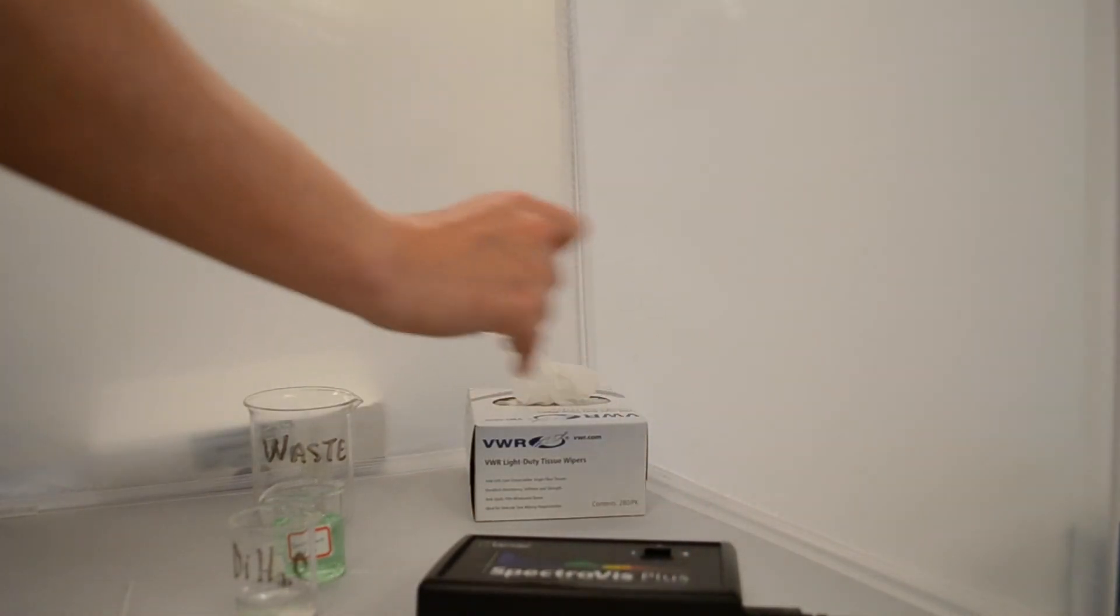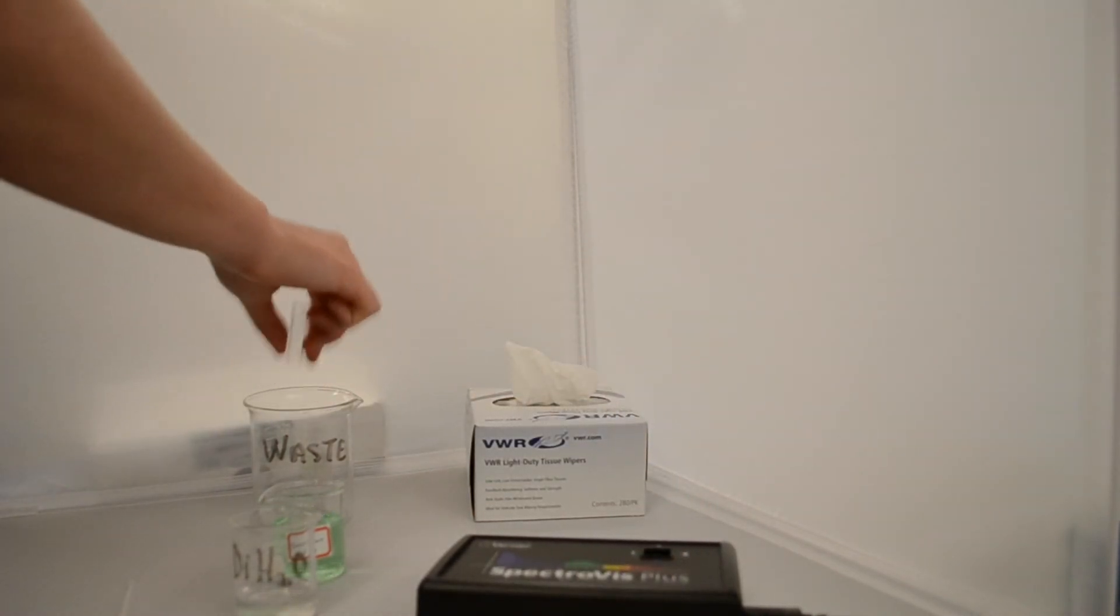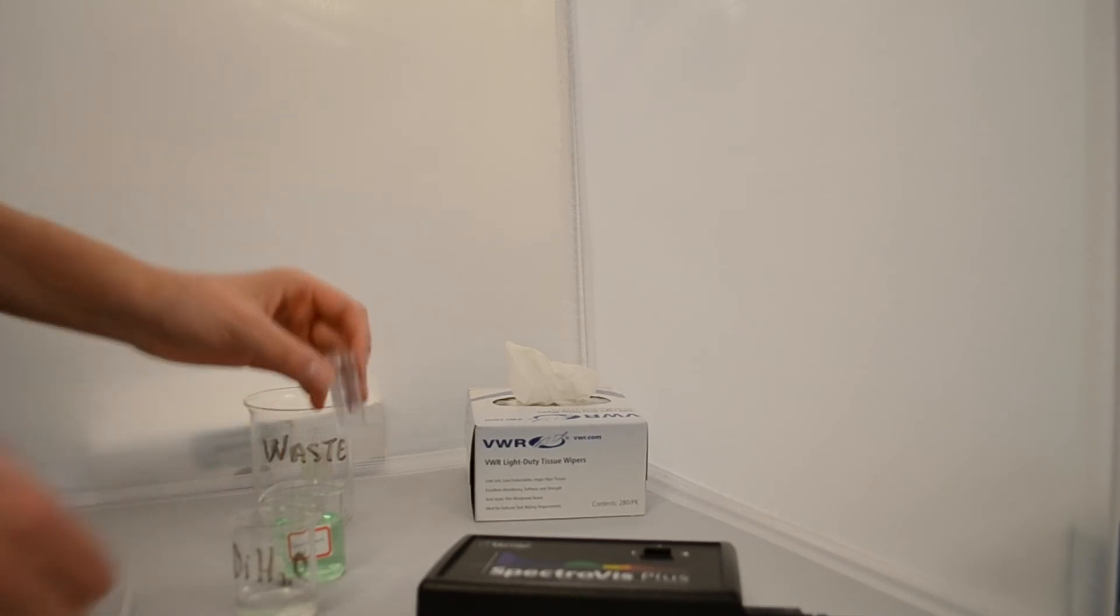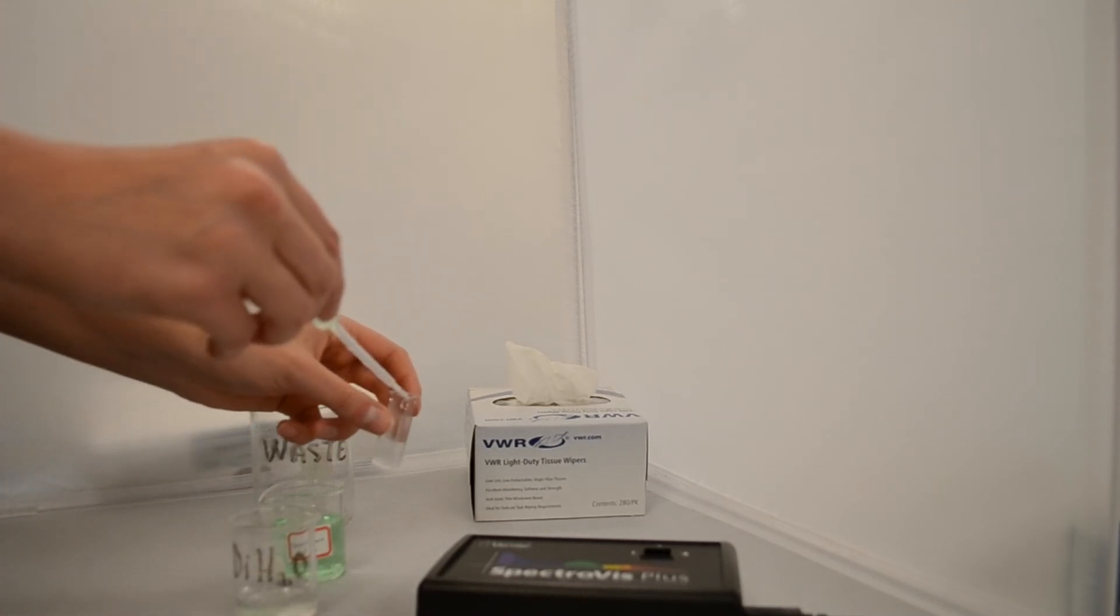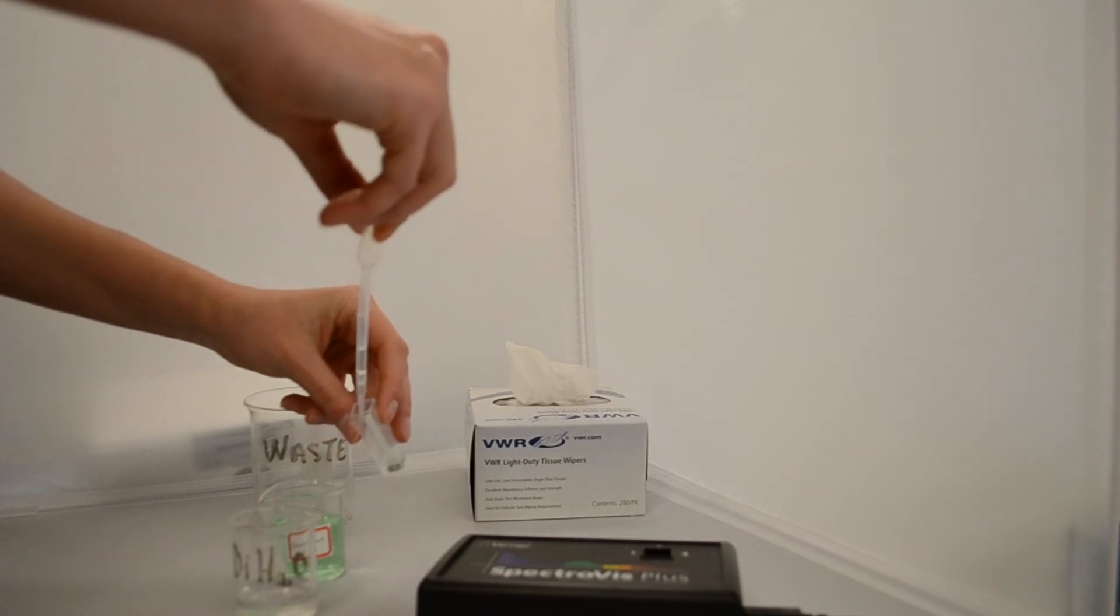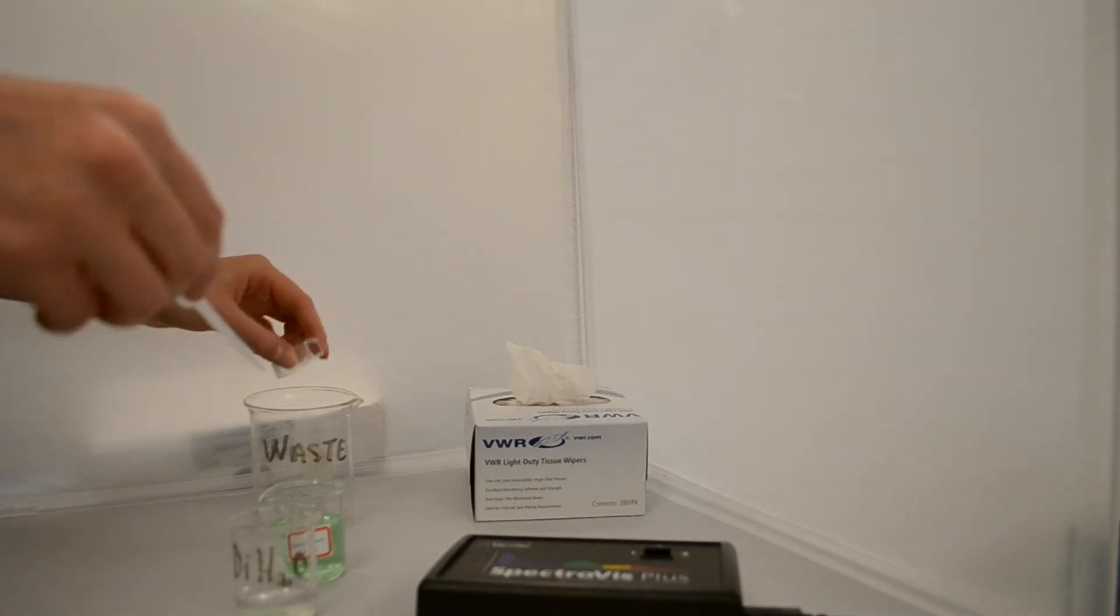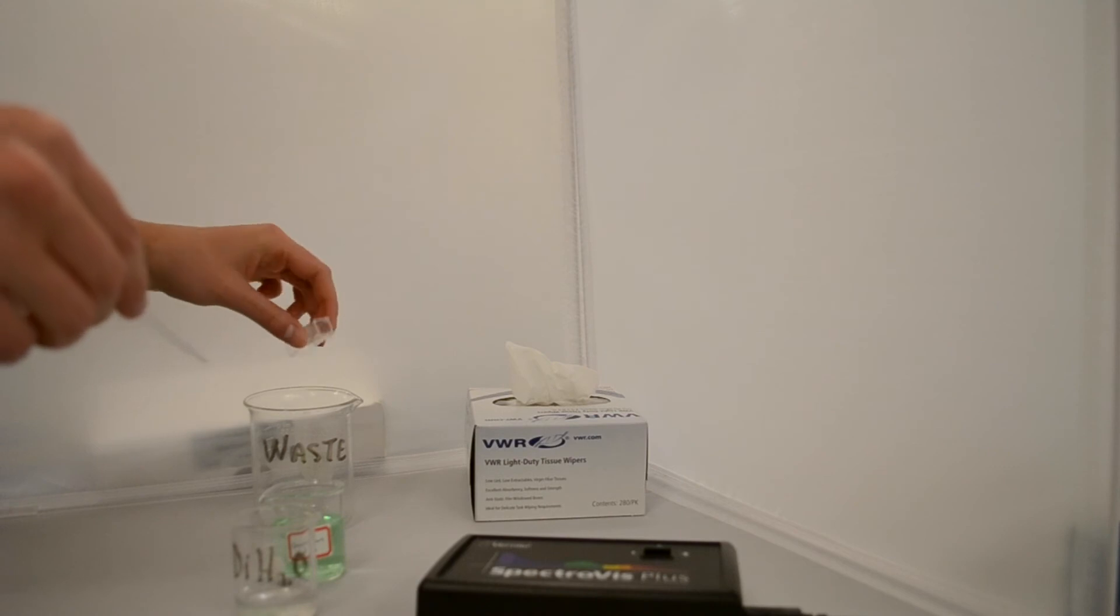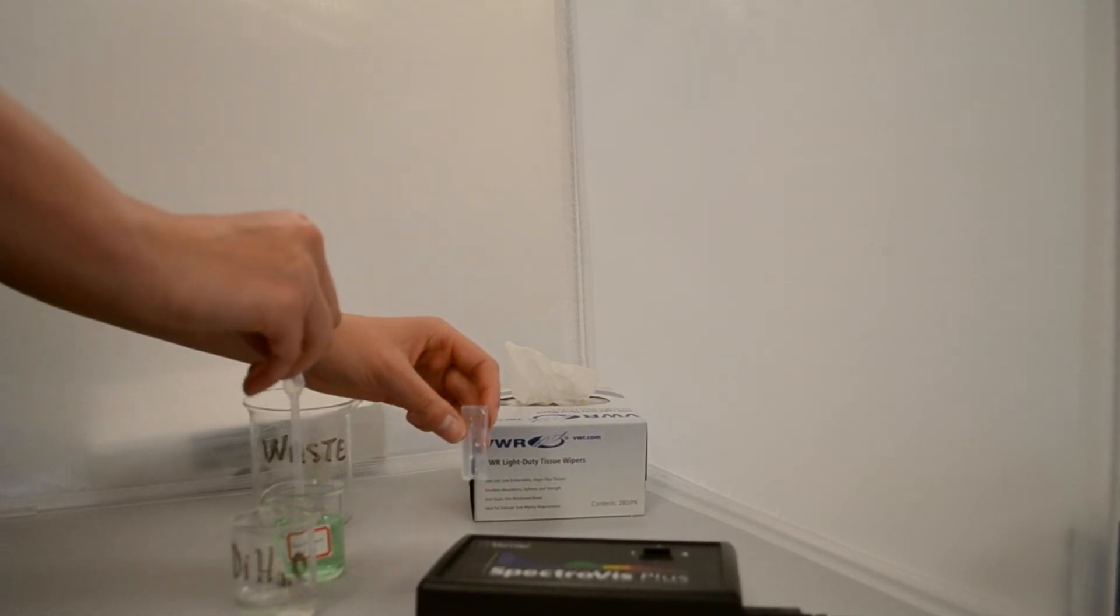Now we are going to measure our solution. First, dump the blank into the waste beaker. Then rinse the cuvette with the solution we are about to analyze. Fill the cuvette two-thirds full with the solution.